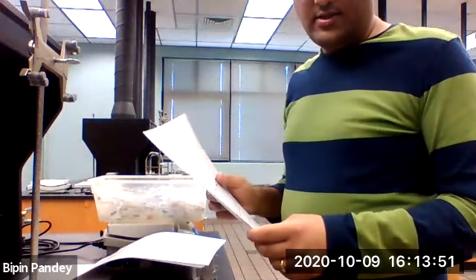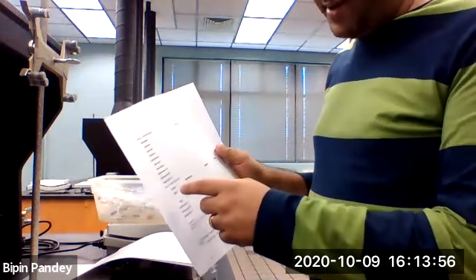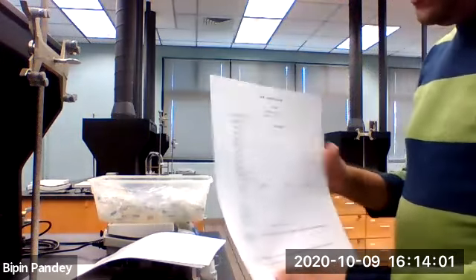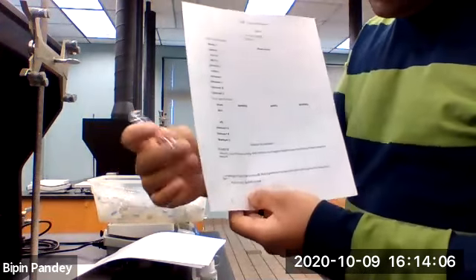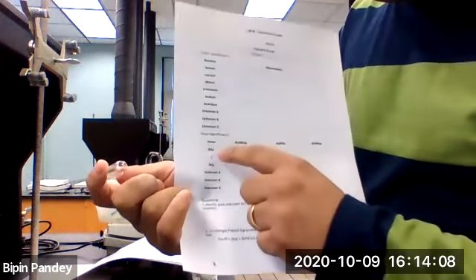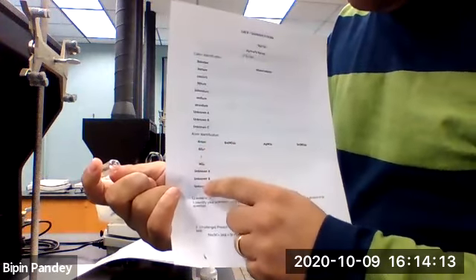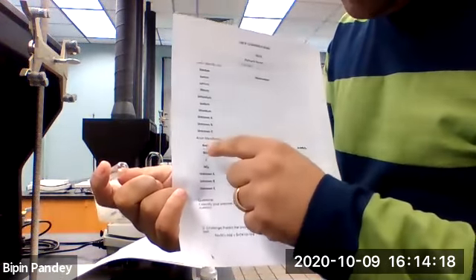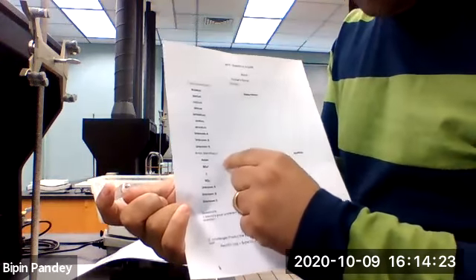All right, so let's resume. We did the cation part, so let's look at the anion part. For anion identification, I'm going to take 6 test tubes and add the known anions and the unknown solution in the 6 test tubes, and then to each of the test tubes, I'm going to add barium nitrate for the first step.